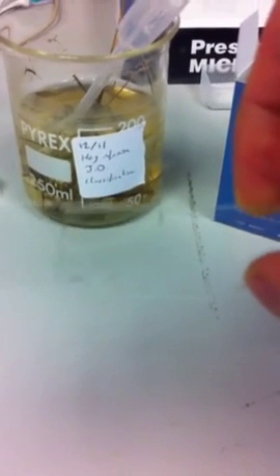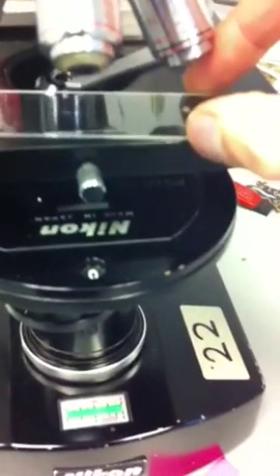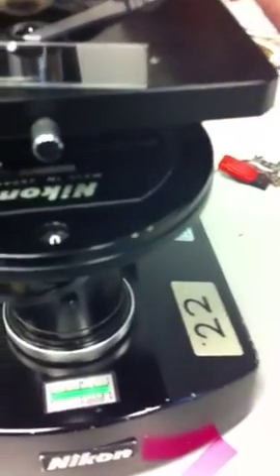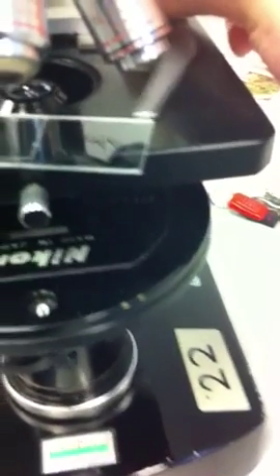Once we've done that, we've got our slide and cover slip on here. Place it onto your microscope stage. Here. Pull that out the arm.